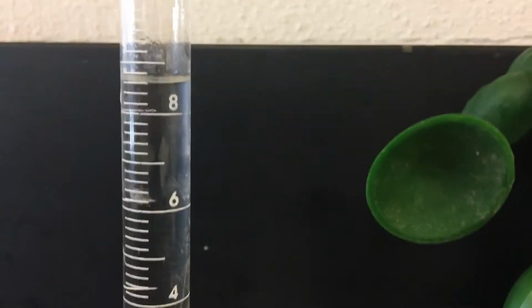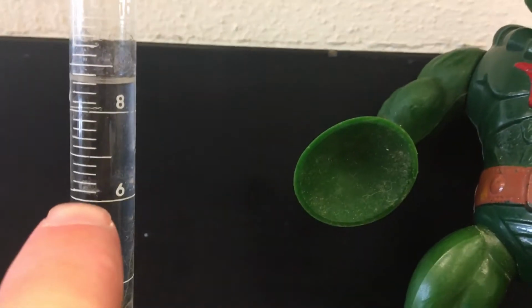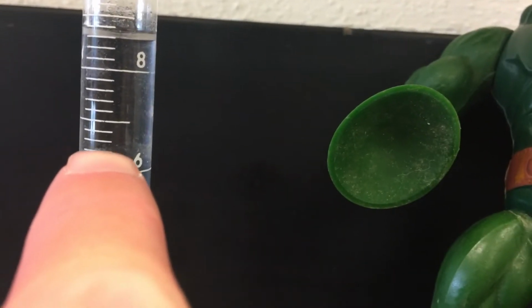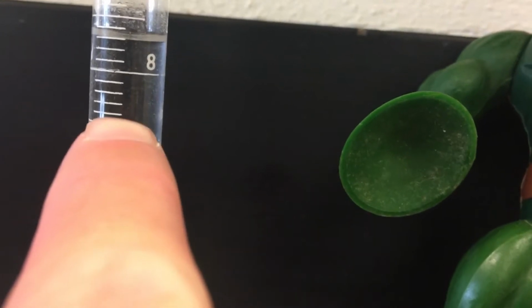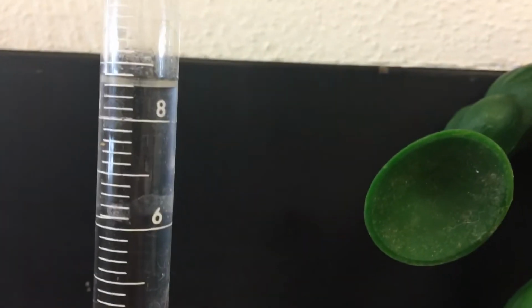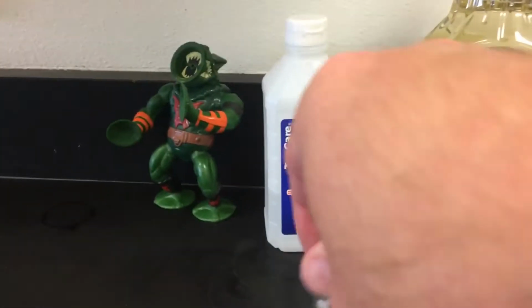And I'm probably gonna want a nice simple background for this. So this is a nice small graduated cylinder. These have an increment of 0.2. So like for example, there's 6, 6.2, 6.4, 6.6, 6.8, 7, and so on. 7.2, 7.4, 7.6, 7.8, 8. So I'll let you figure out using the meniscus about what you see in there. Sound good?